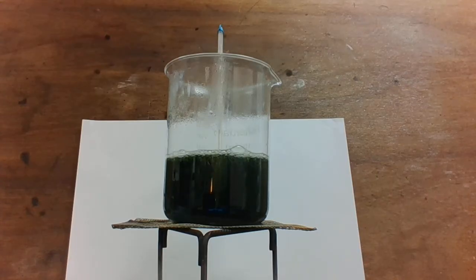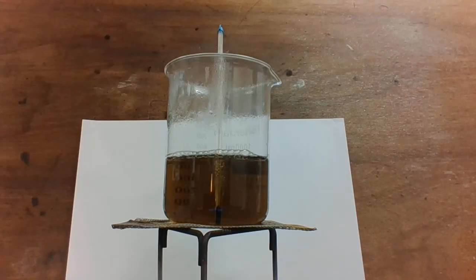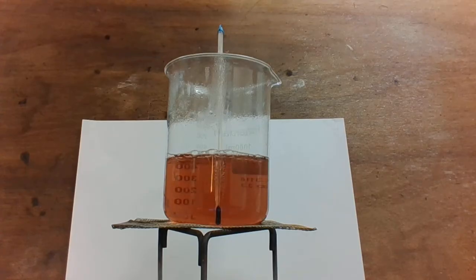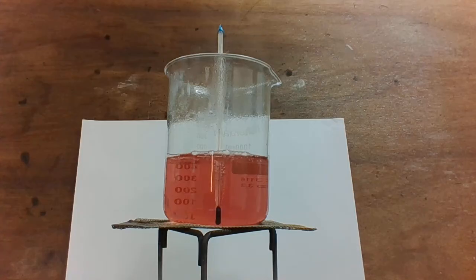As the reaction subsides and the oxygen is released, the catalyst is returned to its original state and goes back to the pink solution of the cobalt chloride. So here the catalyst has increased the rate of the chemical reaction but remains chemically unchanged at the end.